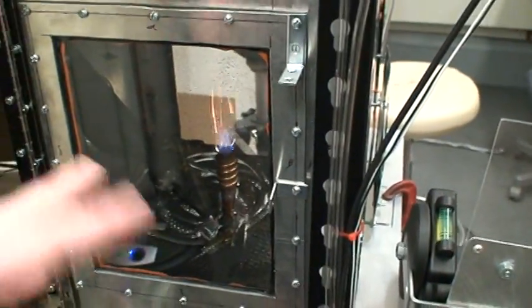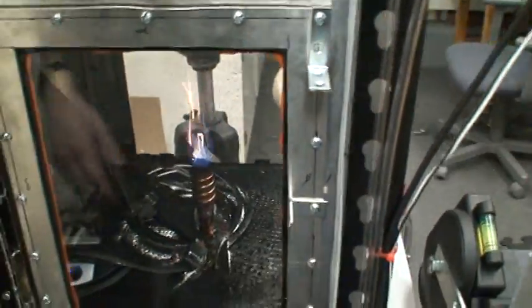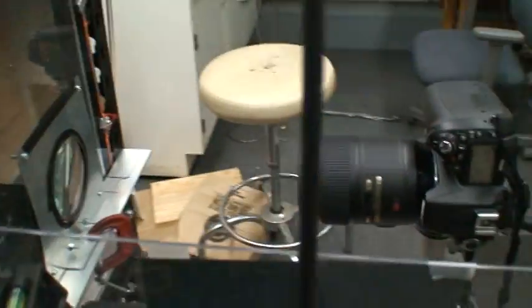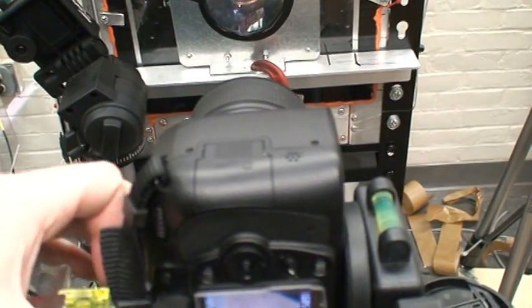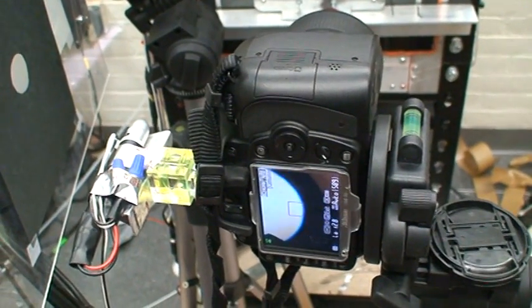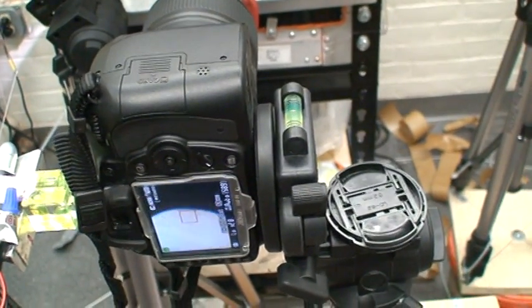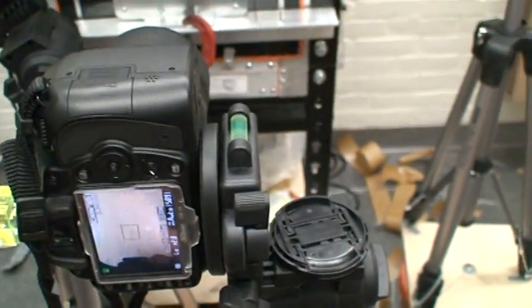Combustion chamber walls, you have to clean them periodically. I was running a test today, so you can see char building up in the shadow there. When char gets either on the lens or on the glass, you'll get black bits on your output image. It is important to get the camera aligned appropriately. Often I will include one of these little hot shoe mounting levels, so that way I can get it level in two directions. So you can see if I'm off by just a little bit, the image washes out and doesn't work so good. So I do have it set up here nicely.